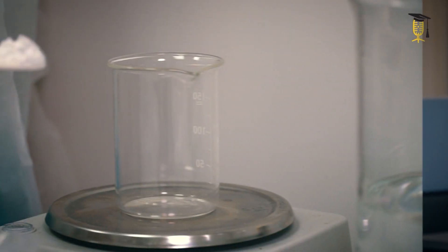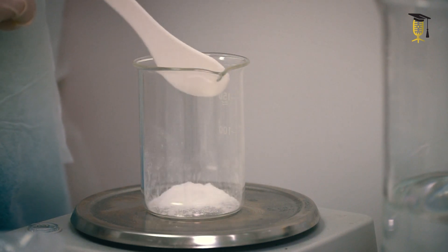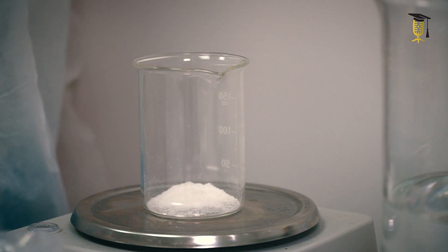What do we do instead? We take a small amount of powder mix into our lab, do a couple of measurements on it, and plug the results into the computer model. The model then acts like a virtual, simplified representation of the production line.